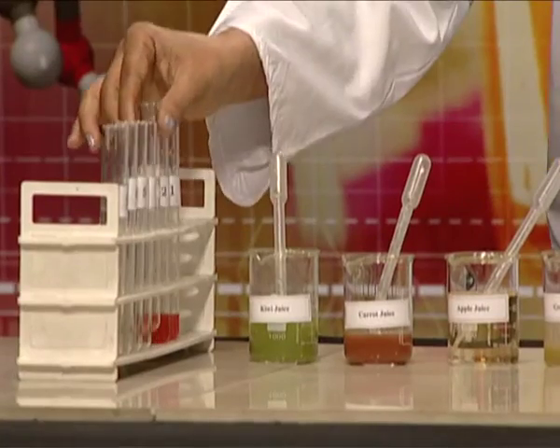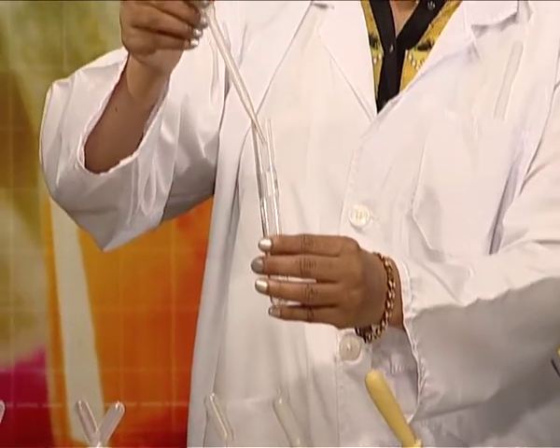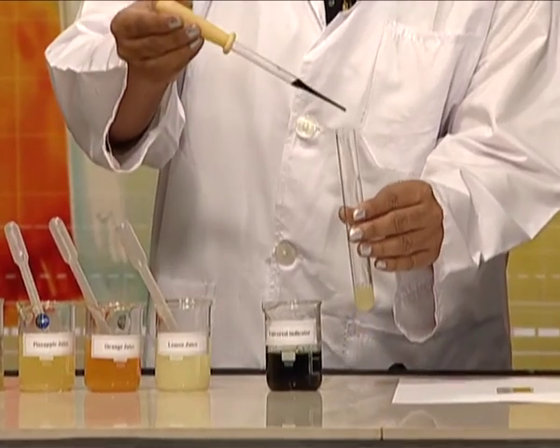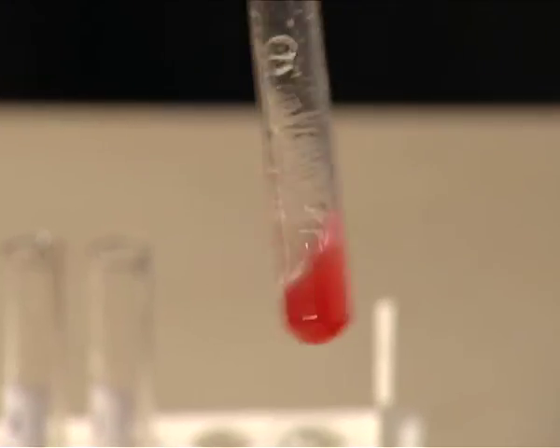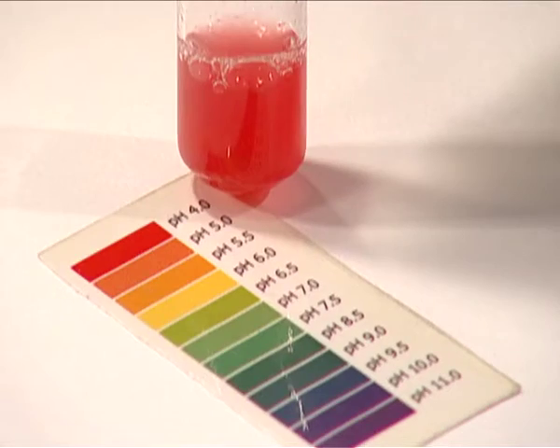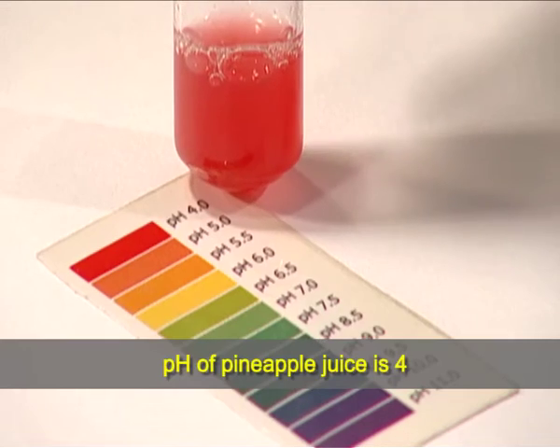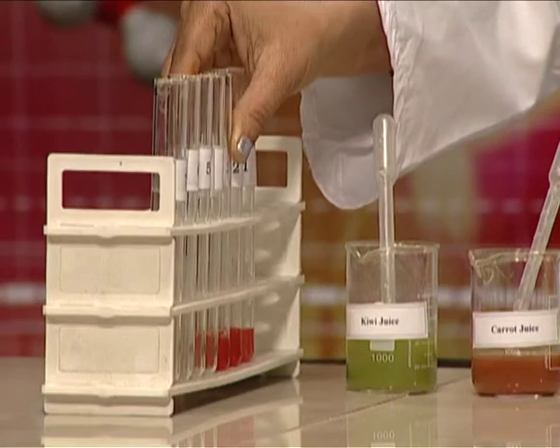Let us take test tube number 3 and I am adding pineapple juice in it. Now, I am adding 2-3 drops of universal indicator in it. Now, I will match with the color chart in which pineapple juice has been taken, shows red color. It matches with pH nearly 4.